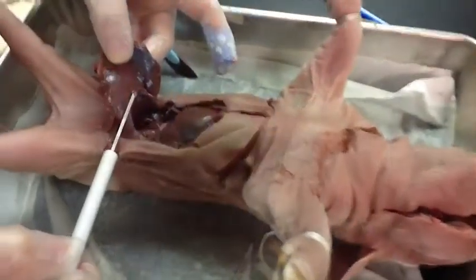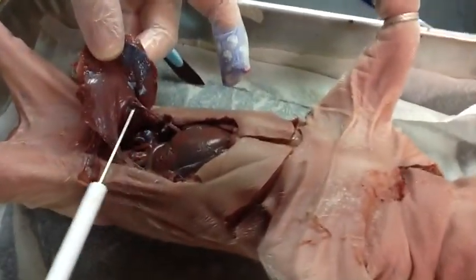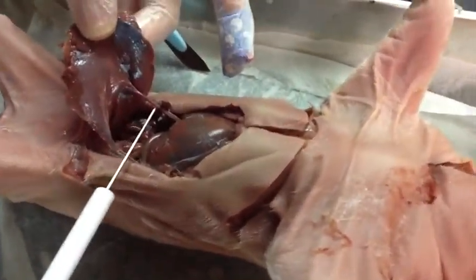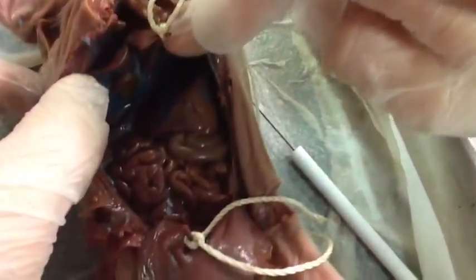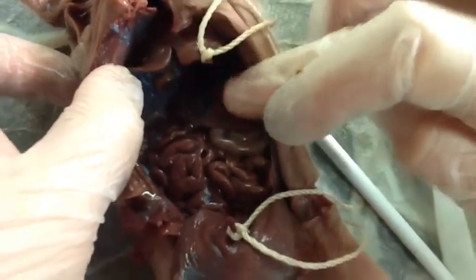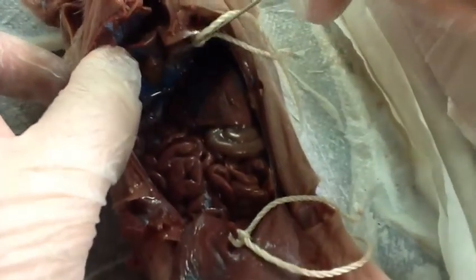Though part of the circulatory system, in the next few videos you will also see the spleen. The spleen is responsible for filtering blood. As we started to dissect the pig, we found the umbilical vein, which runs from the umbilical cord into the liver. Here we have the liver, and underneath we see the umbilical vein that we've cut and the second lobe of the liver, as well as the gallbladder right here.